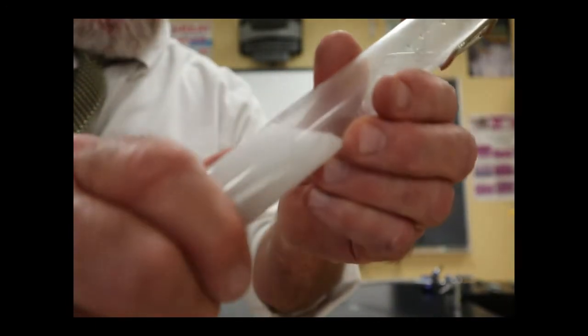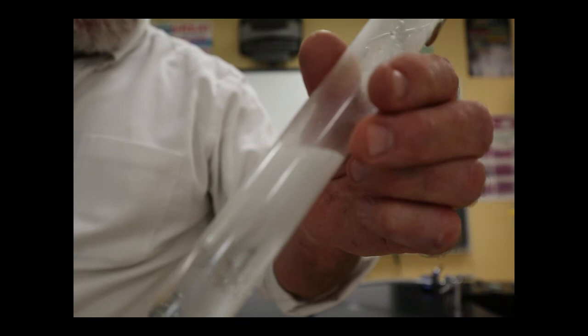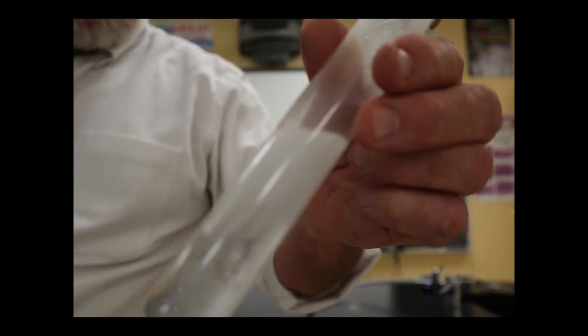Actually, this is getting pretty warm now, where I'm holding it here. It's getting pretty hot. As it heats up, it seems like it reacts a little faster. The bubbles are coming up a little more quickly. So that'll help make the reaction go faster.